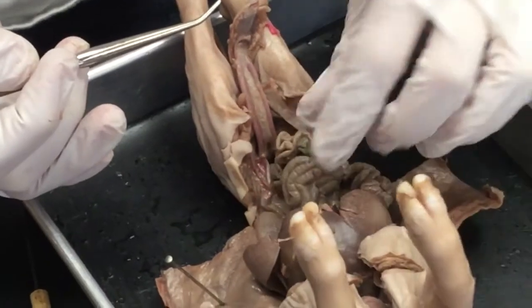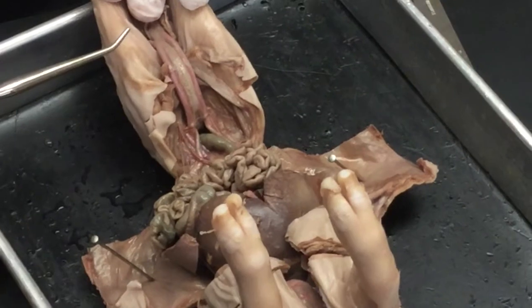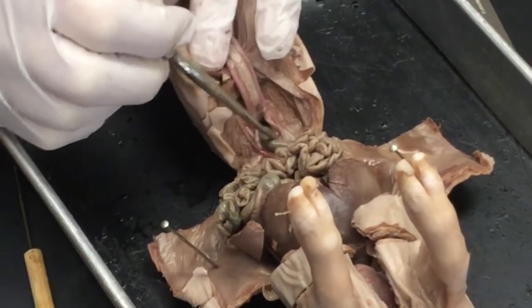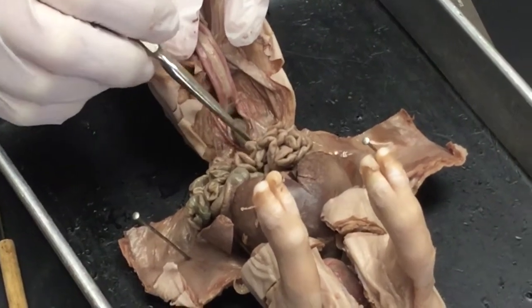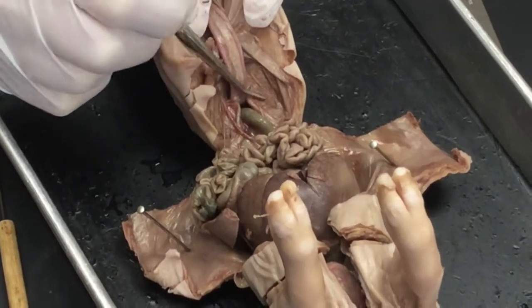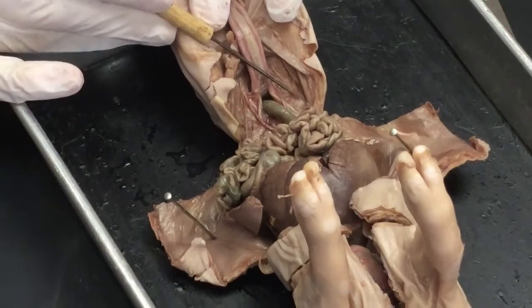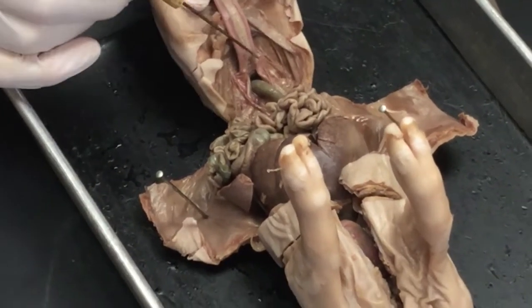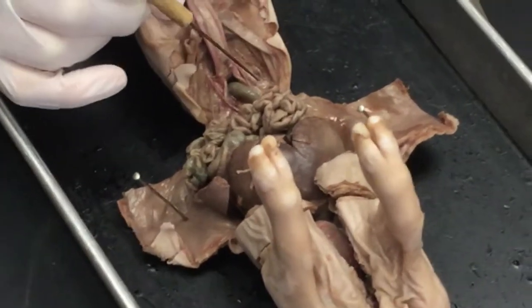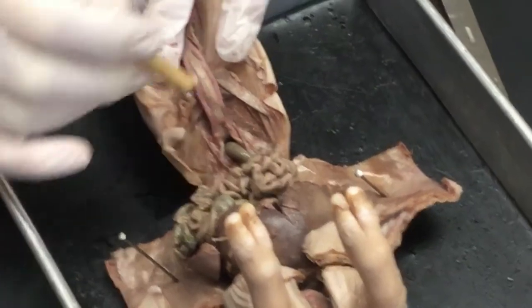So with this being a male, you can look down here and you don't really see the ovaries like we saw before, but there are testes here. We just have to locate them. So I'm going to look behind the rectum and kind of move it to the side. The rectum is kind of large in this particular pig, and I'm going to take this sharp pointer and cut away at some of the film that we have here. And I'm looking for the testes.